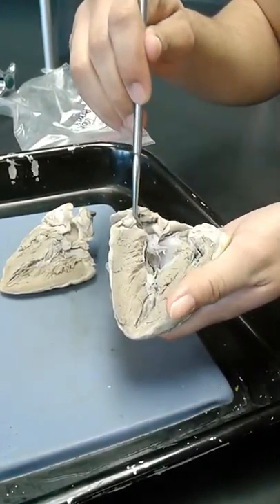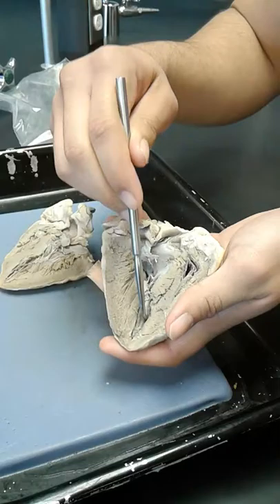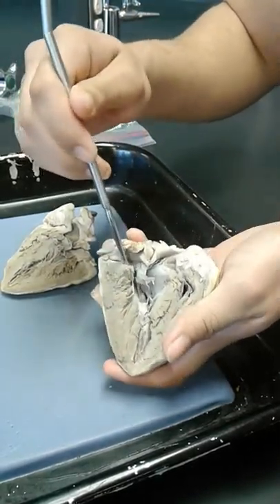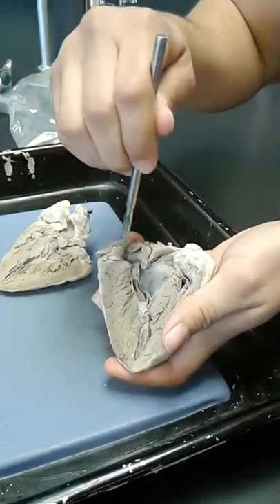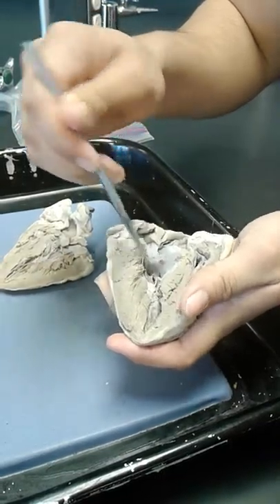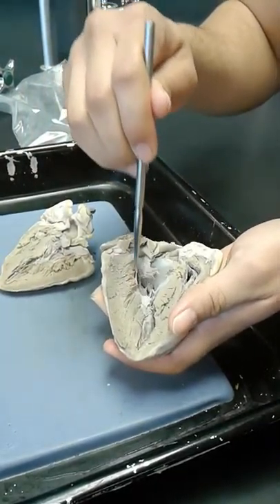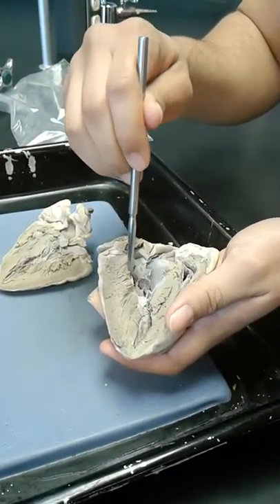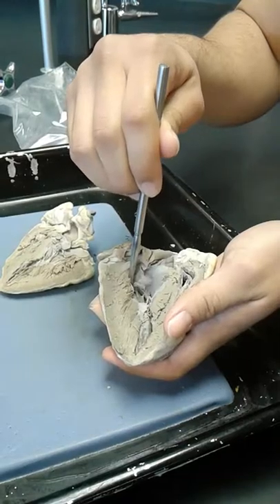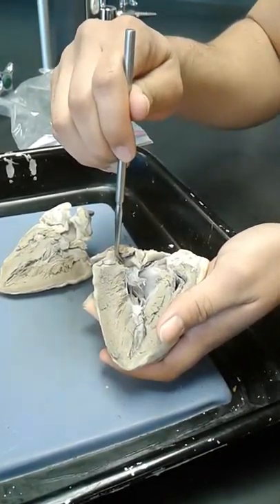Through the left atrium, it gets pumped into the left ventricle. Here is the bicuspid valve — this flap right here. And here are more chordae tendineae and more papillary muscles, which control the valve, so it prevents backflow back into the left atrium.